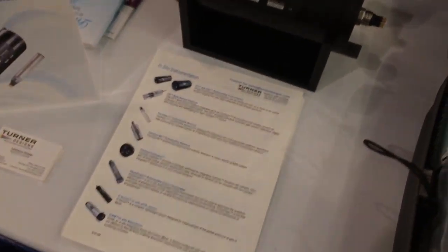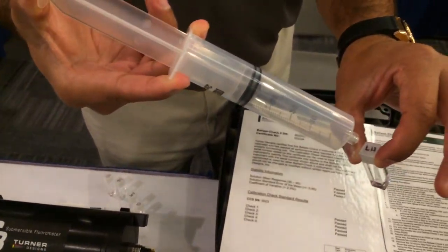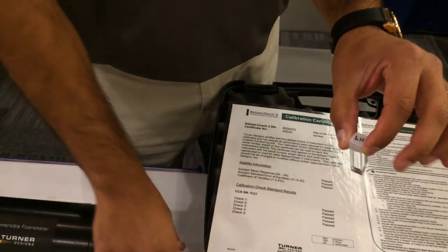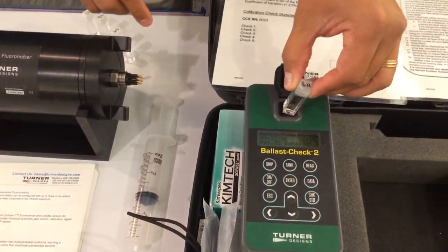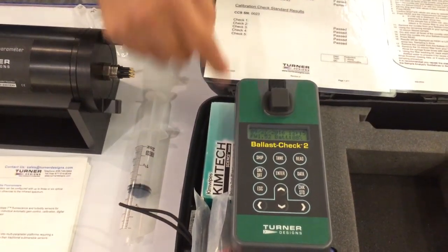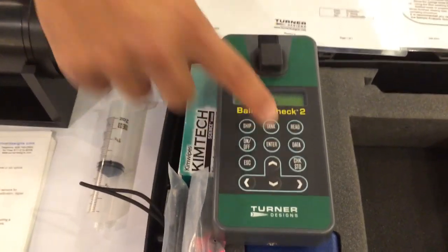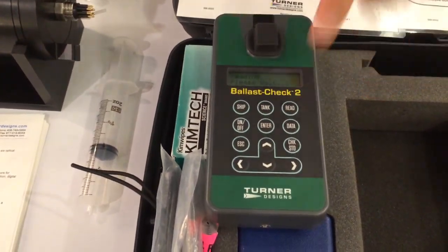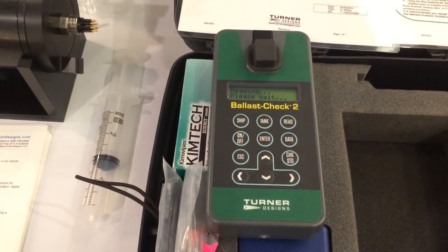You take that one and then take that sample just from your ballast tank, and you put that into your cuvette. You put the cuvette into your sample compartment, you press read, and that's as easy as it gets. You press read and it's going to read the sample for you.